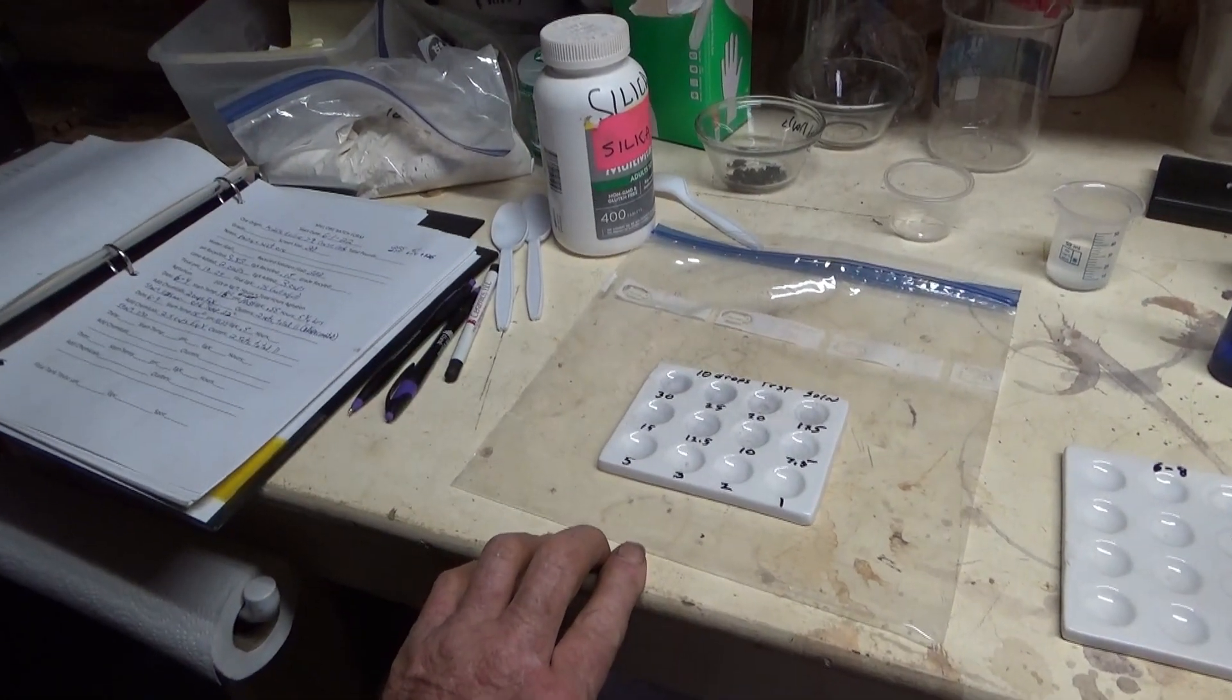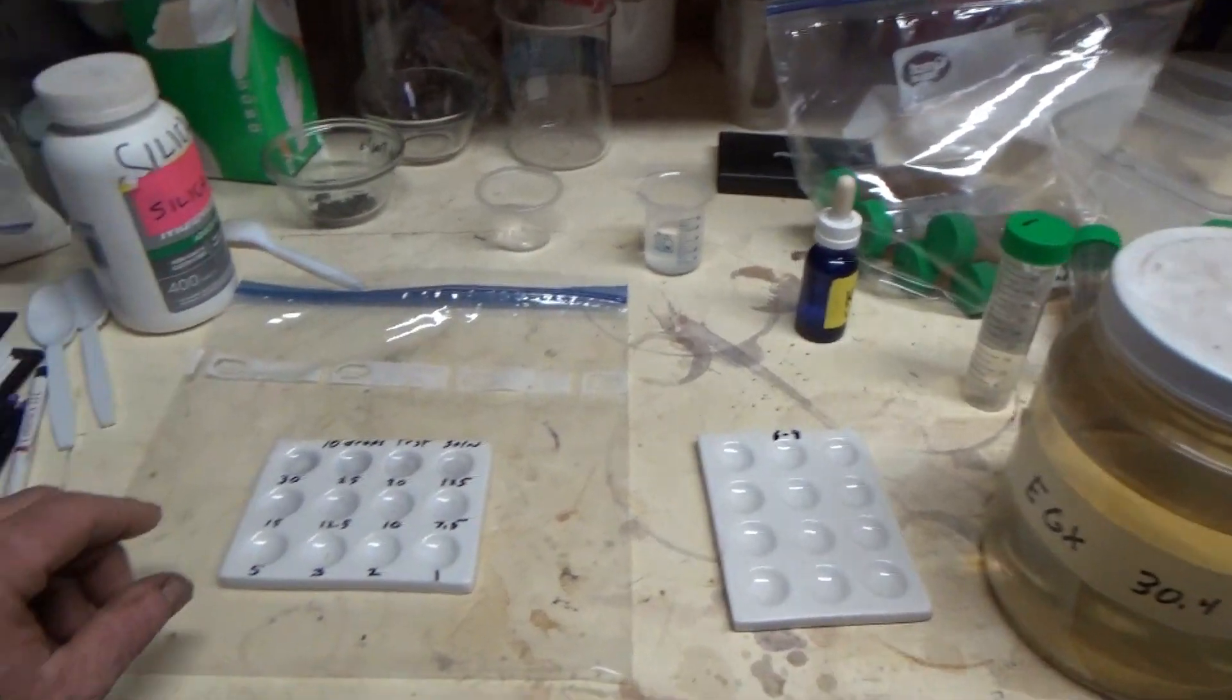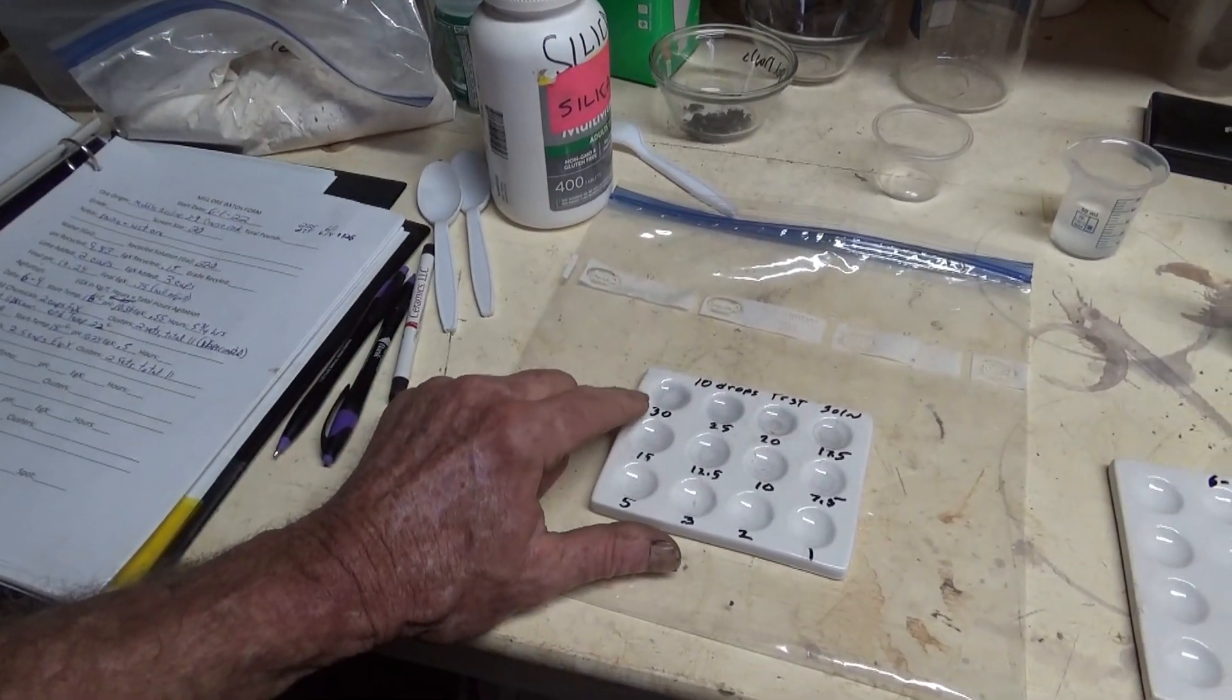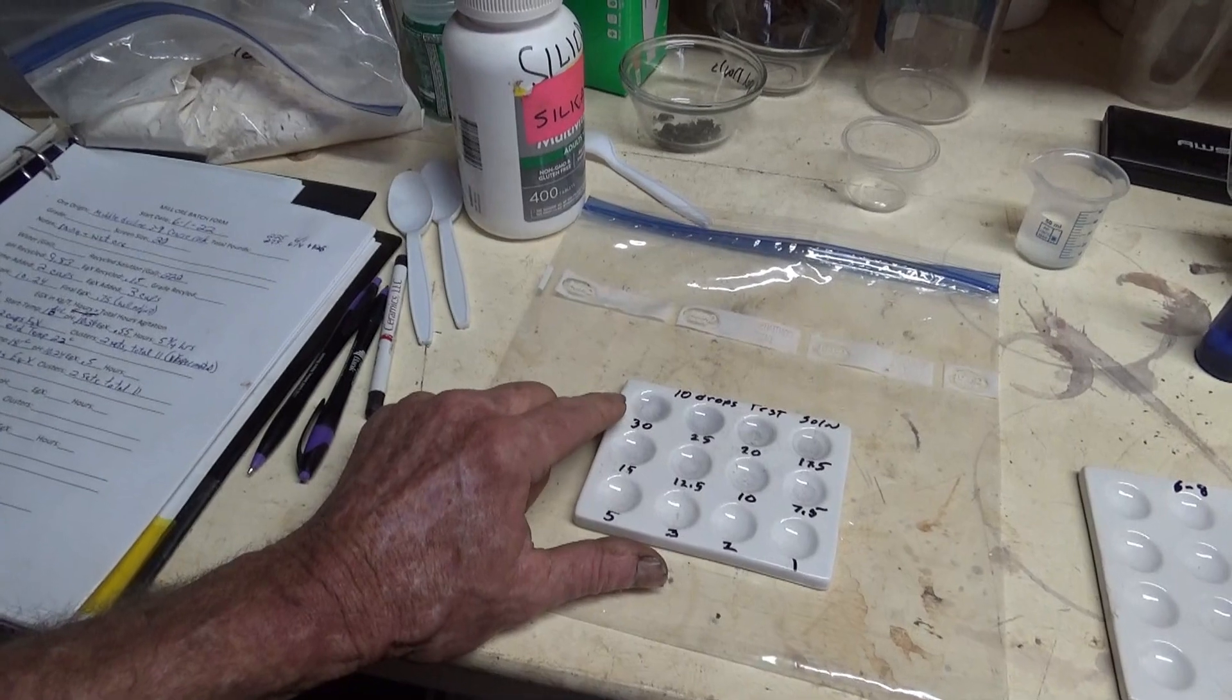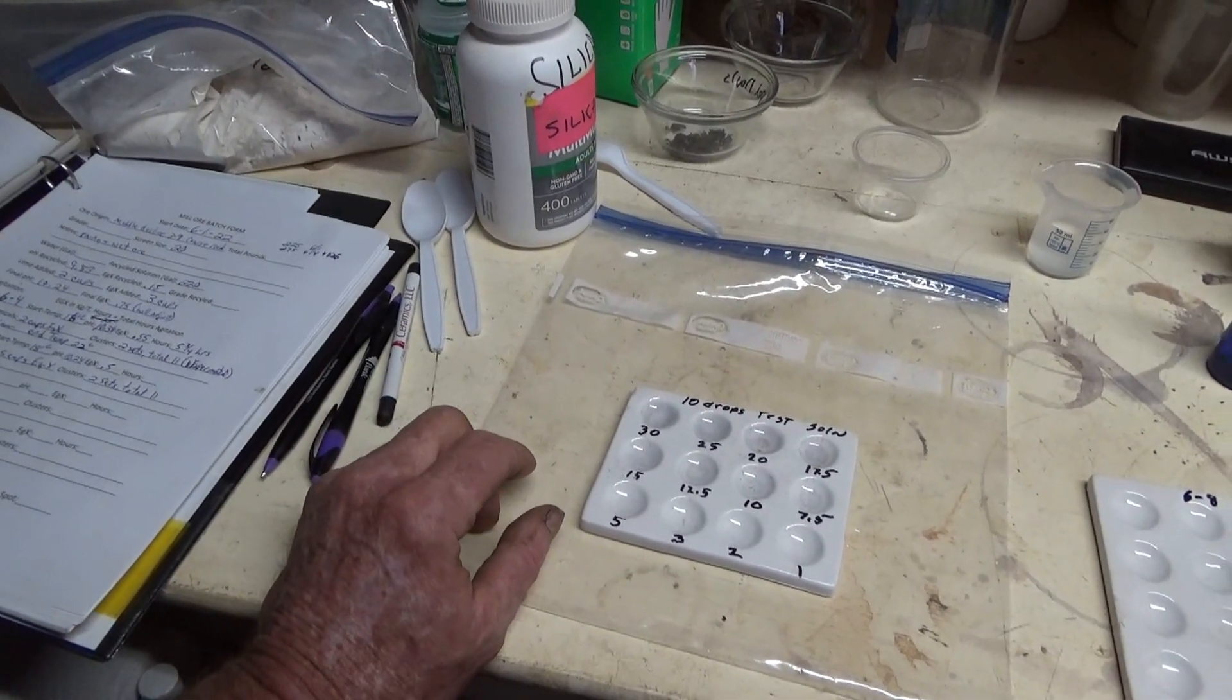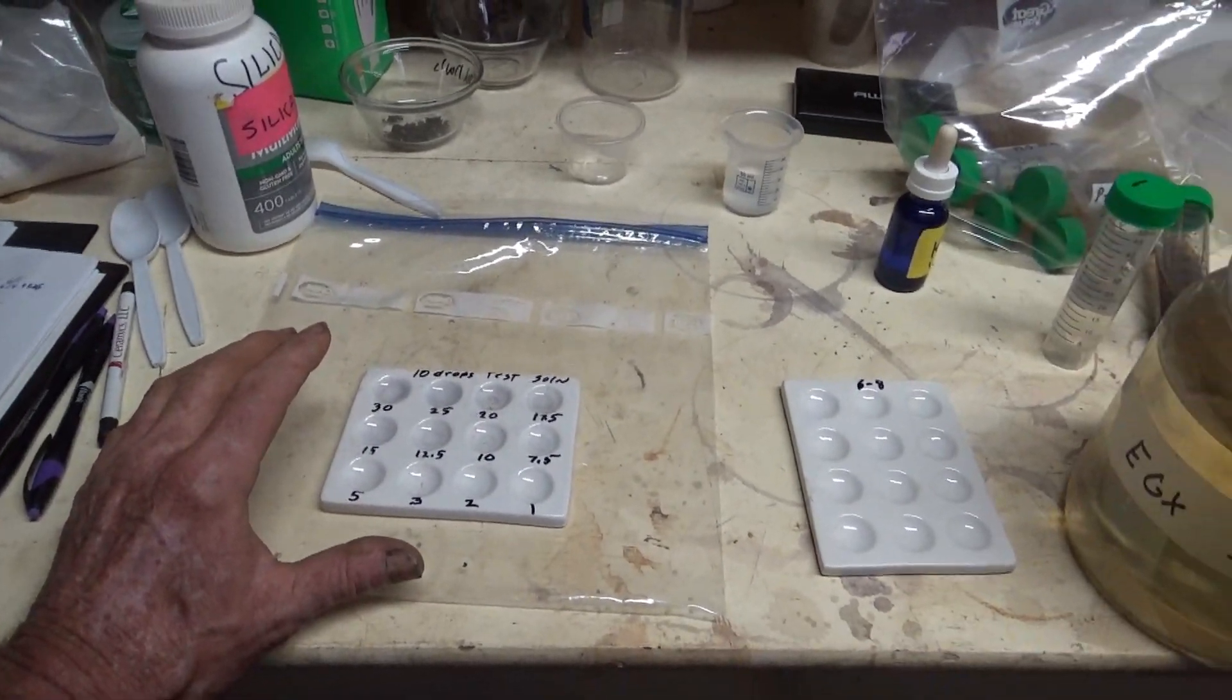Obviously we can't go any more concentrated than what we started with, but this is actually more than most of our leach solutions will be. We're generally running in the 12 to 15, so this should give us what we need.